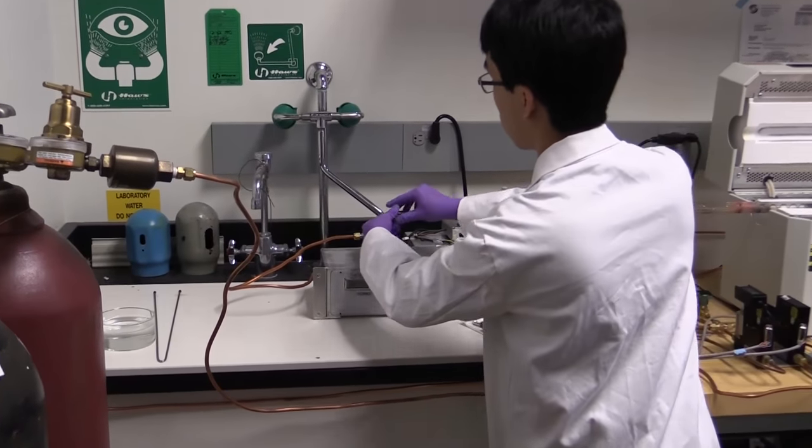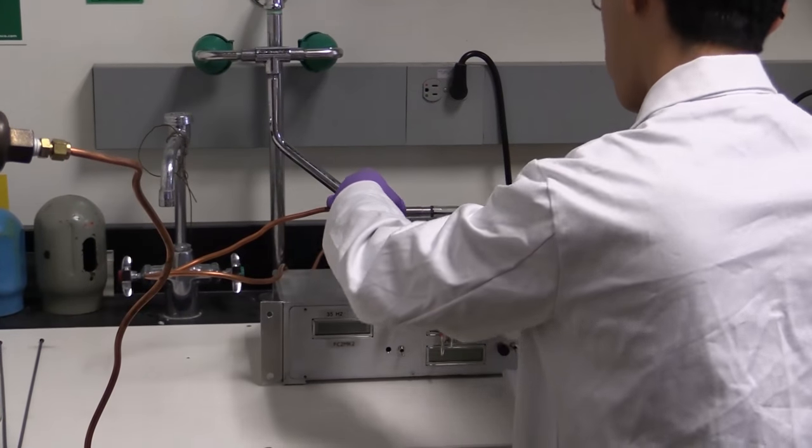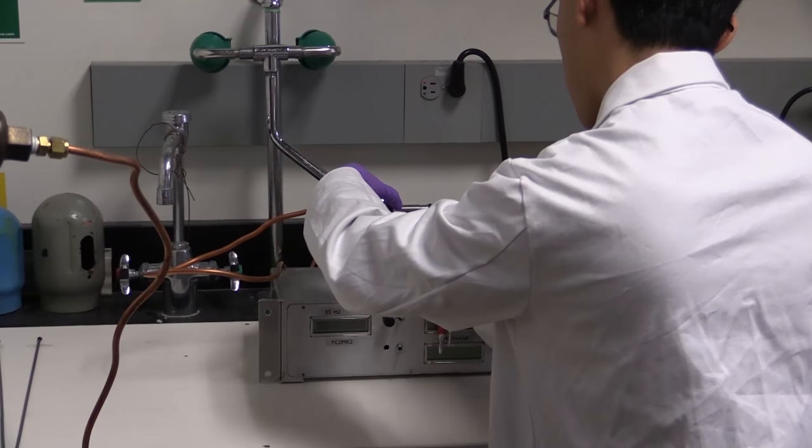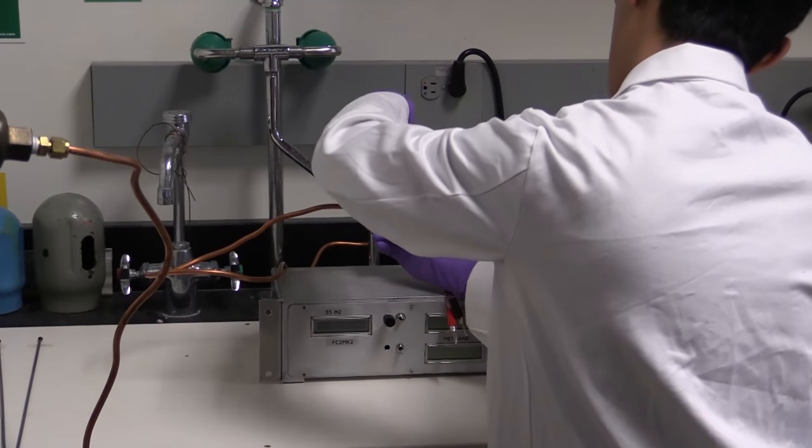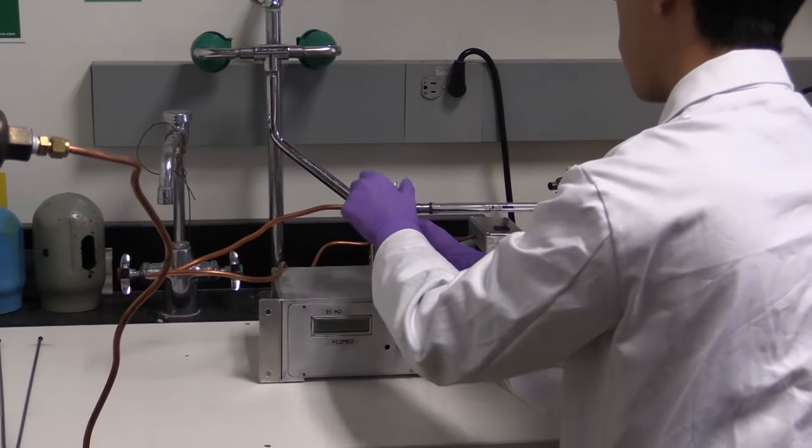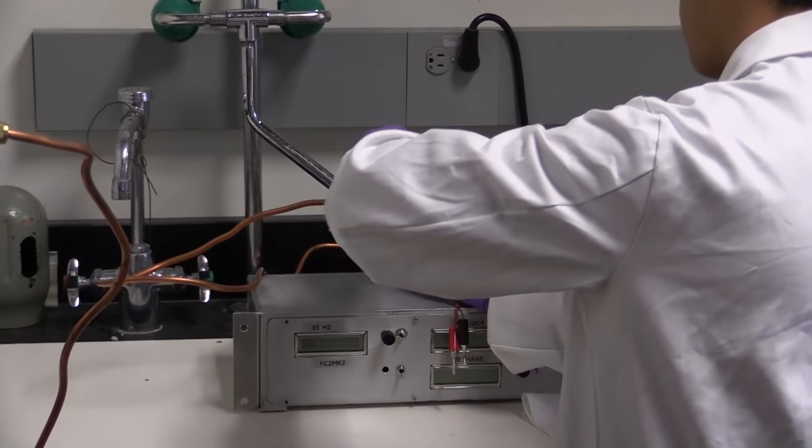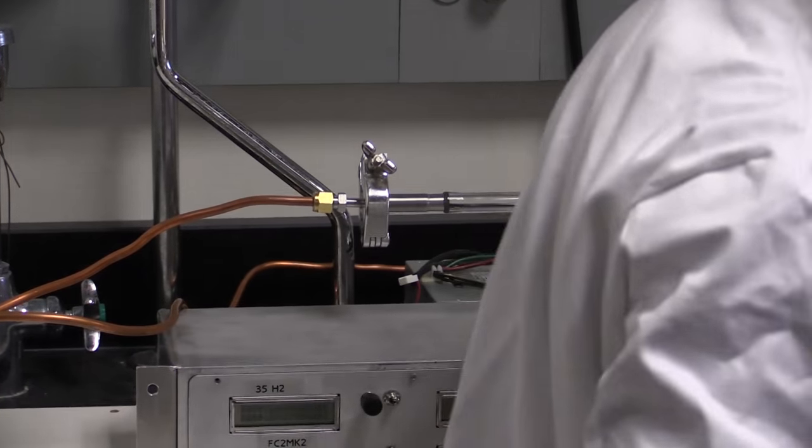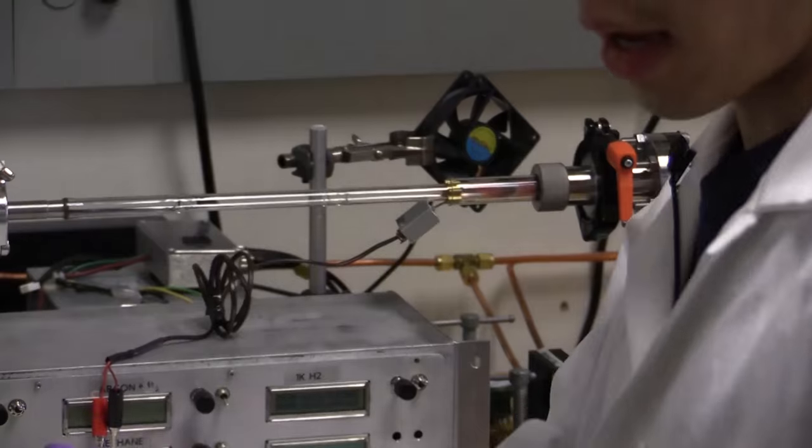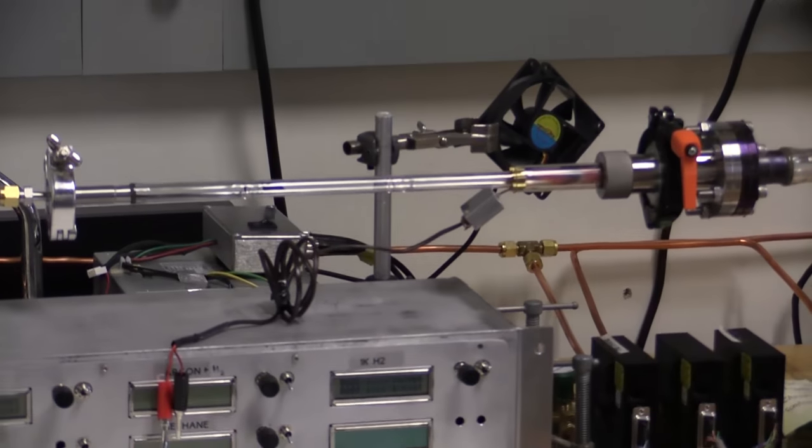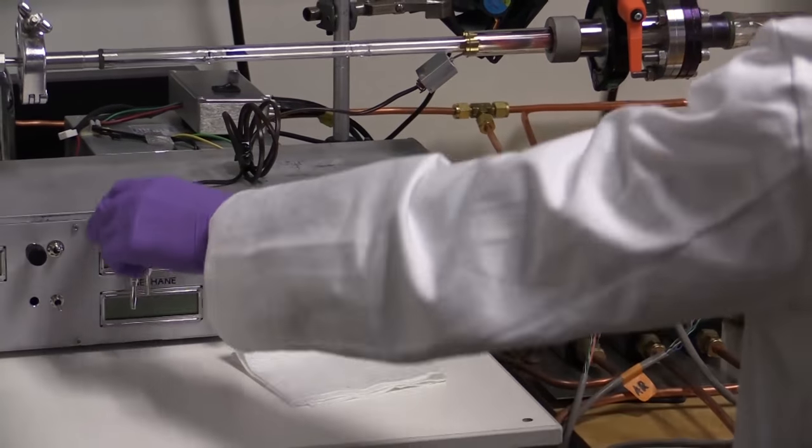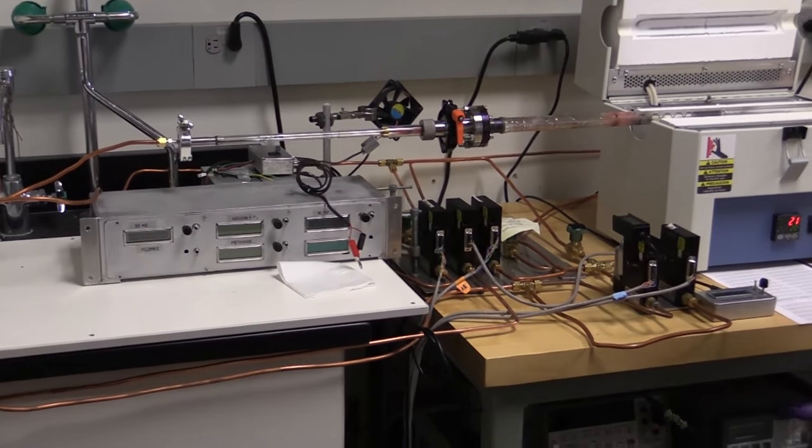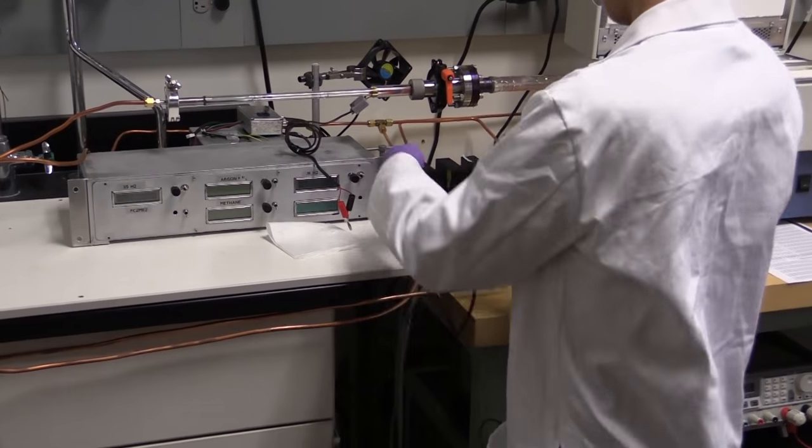This feeds to our flow controllers, which are connected to our gases. Now, we go ahead and connect our thermocouple to both the multimeter and our power supply. With this here.